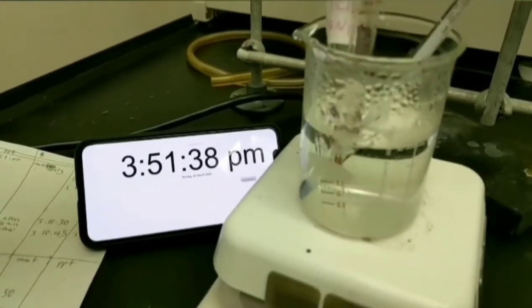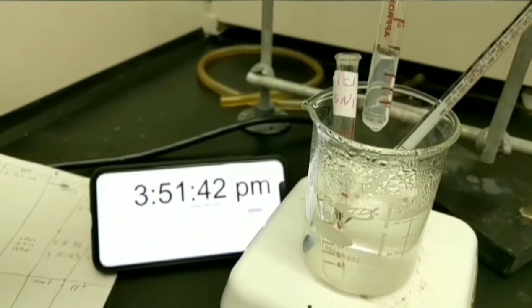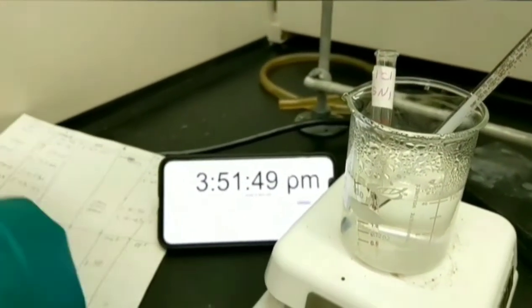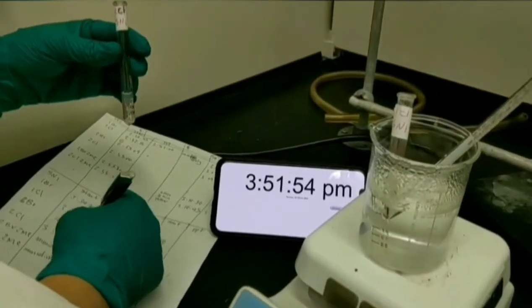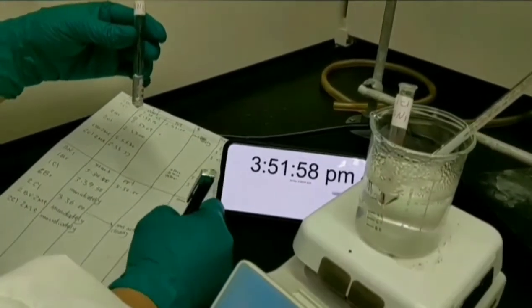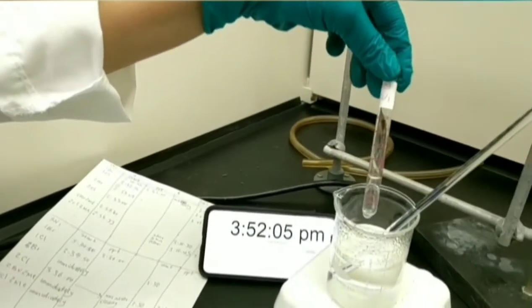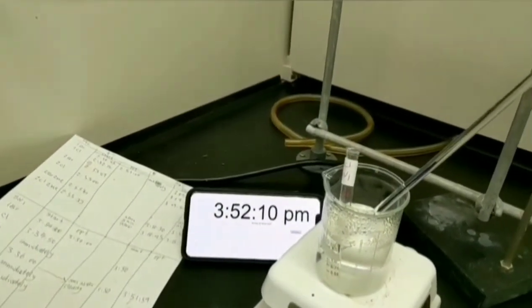There is a more obvious cloudy solution for 2-chlorobutane. You don't need to record a new time. This reaction was completed in room temperature. Just write your observation about this reaction in water bath temperature. For 1-chlorobutane test tube, as you can see, there is no precipitation, so we need to leave it to stay more in water bath. I'll be back to show you any changes later.